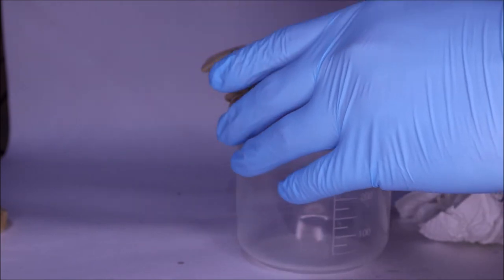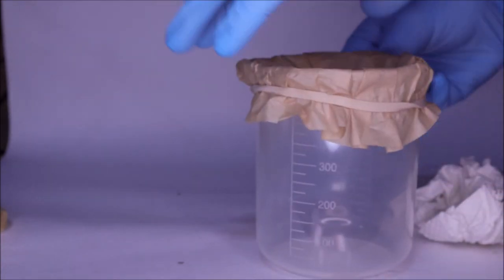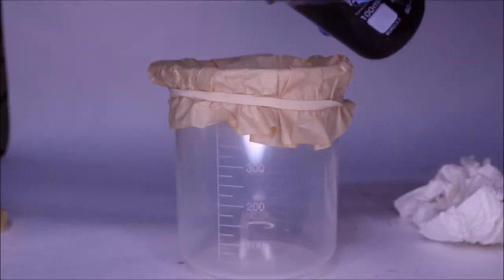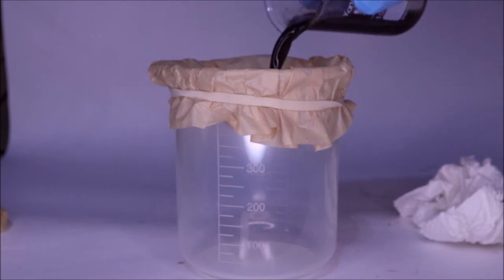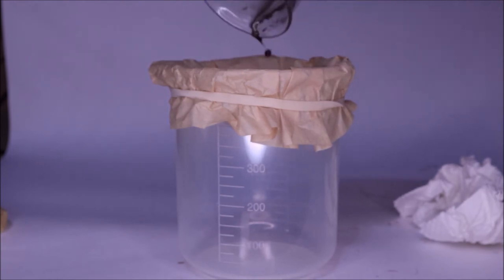After this I really had to think about what I was going to do because I was banking on that idea to work. My next idea was to perhaps try and filter off some of those colored materials, but that didn't work either. It actually didn't filter at all, which is a shame. I ended up having to just pour it back into its original container.